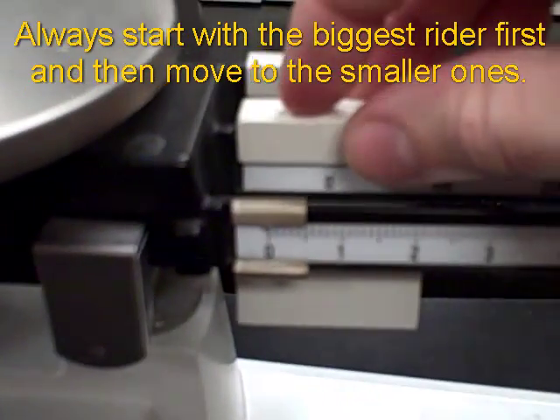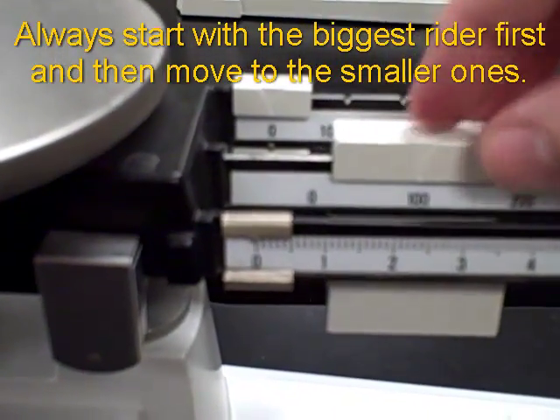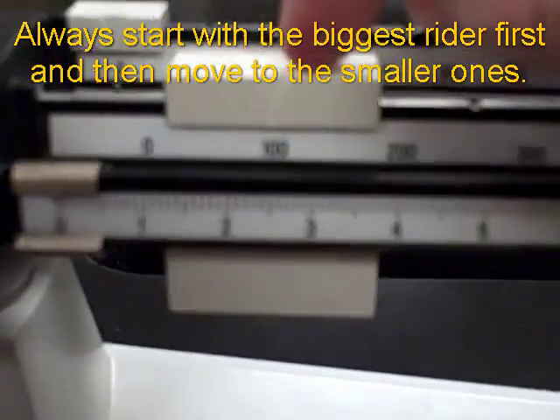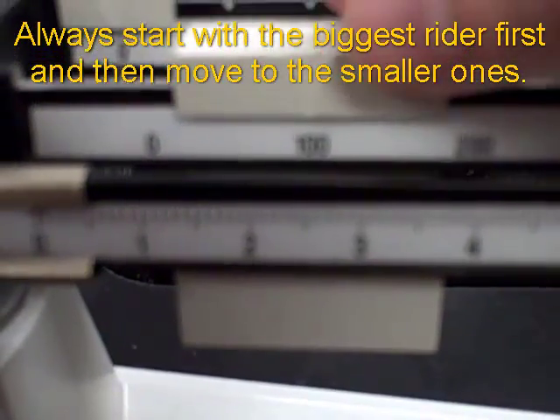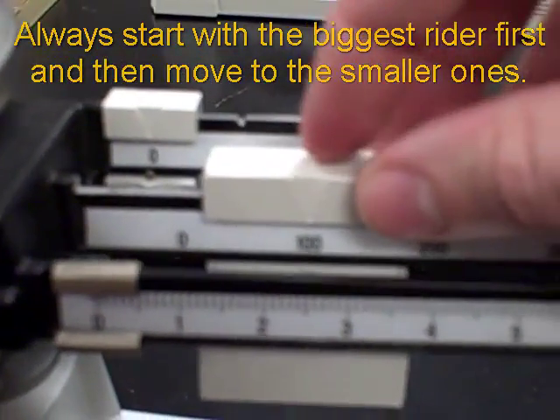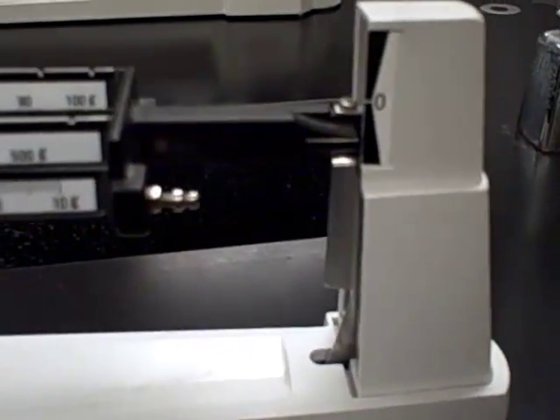I shift that over to the 100 mark. You need to make sure it's in the groove right there at 100, and that still hasn't weighed down. So I'm going to shift over to the next one, 200. That went too far, so I'm going to drop it back to 100.